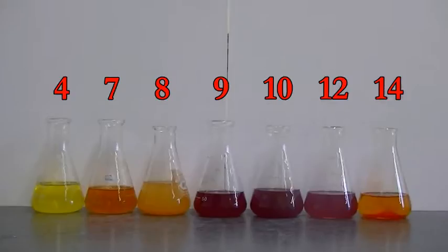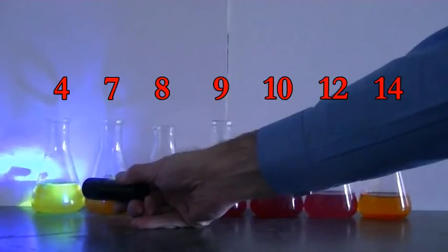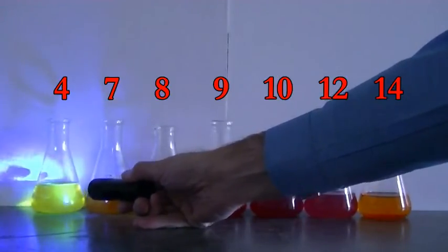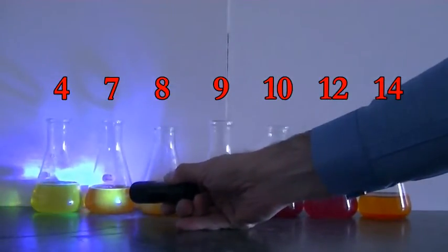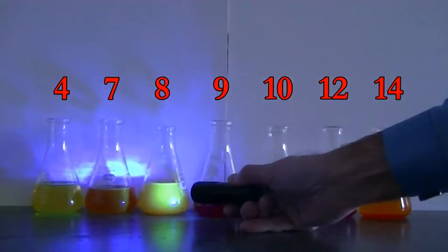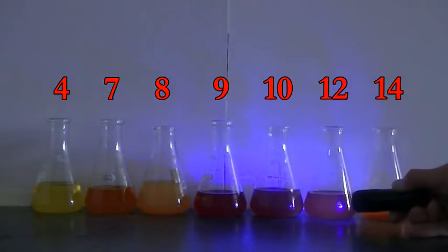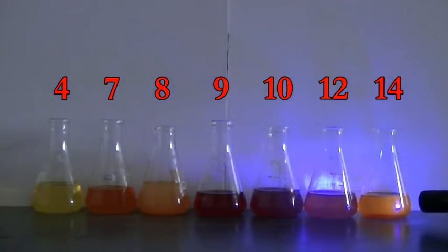Let's observe the fluorescence of each of the resulting solutions. You see a nice yellow-green fluorescence at the low pH that persists fairly well at pH 7 and at pH 8, that fluorescence appears to be lost at pH 9, 10, and 12, and yet there seems to be a little bit of orange fluorescence that's regained at the very high pH.